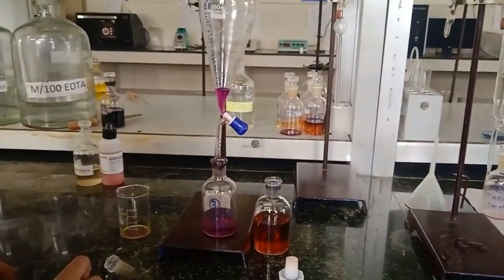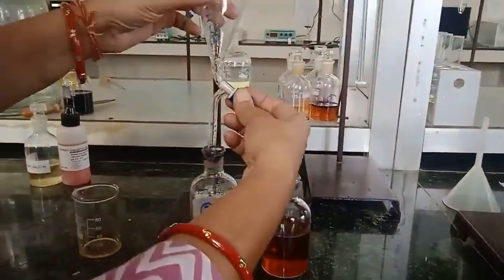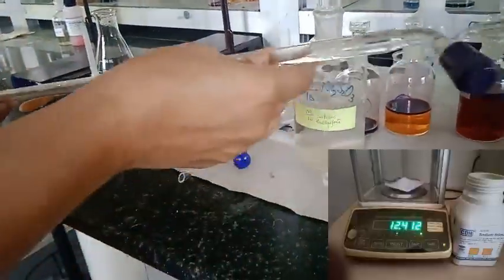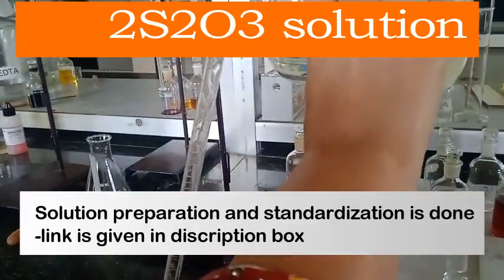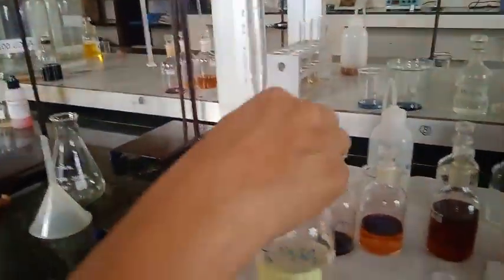In this manner we have separated the organic and aqueous layers for all three sets. Now we are going to titrate with M by 10 sodium thiosulfate solution. Preparation is given in the previous experiment. We rinse the burette with this and now fill.